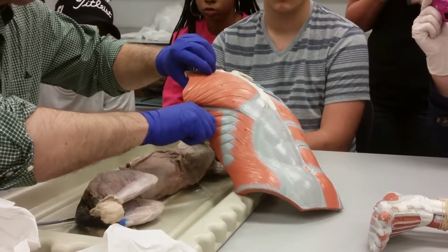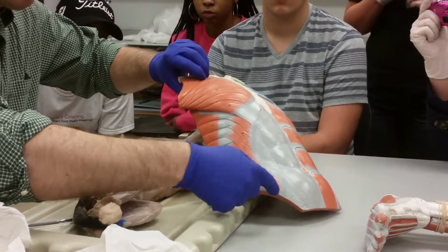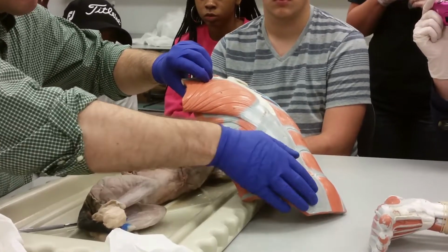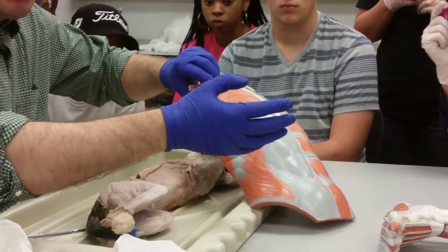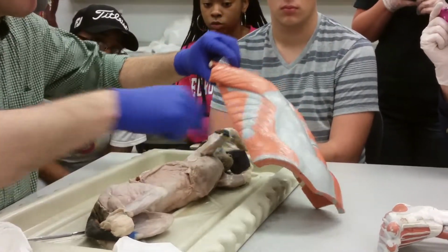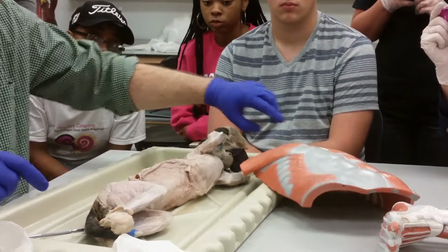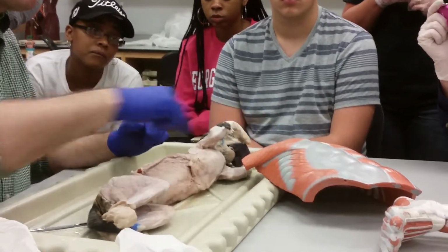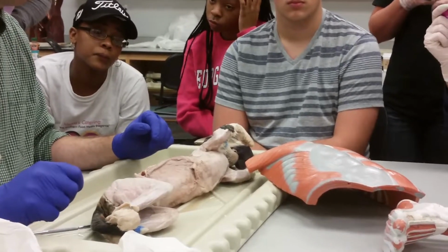But also, it's going from ribs down here, we see this is the iliac crest, so it's going down to the pelvis at an angle. So if we think about what bones it moves, well, it's going from ribs to pelvis. So what movable joint is between the ribs and the pelvis? Right, the vertebrae. So it's pulling from the front of the vertebral column between the ribs and the pelvis.